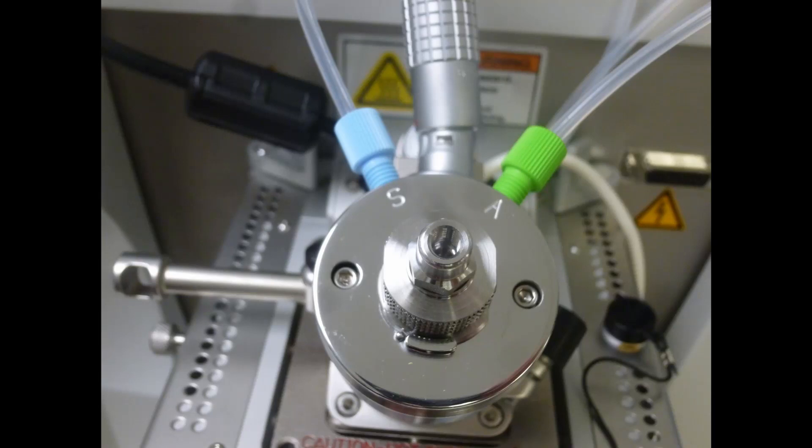If you're not sure which way the gas lines go, look at the engravings on the probe and make sure they match the engravings at the other ends of the tubes on the instrument itself.